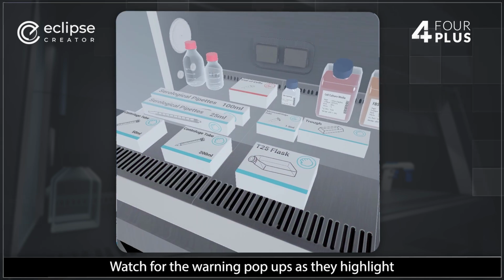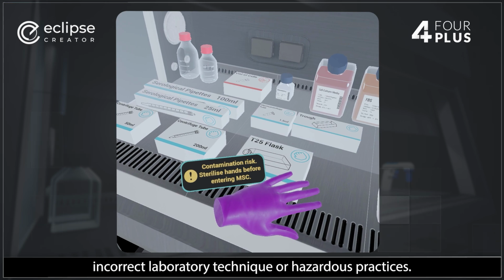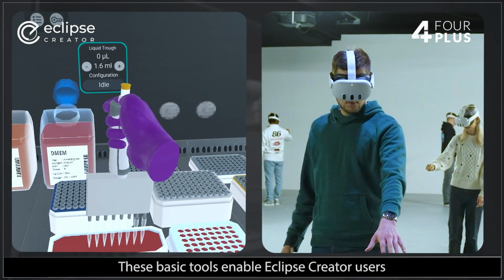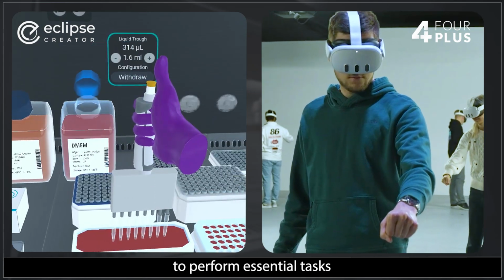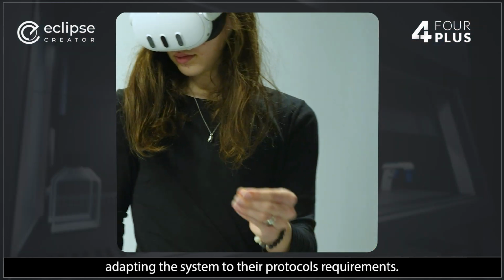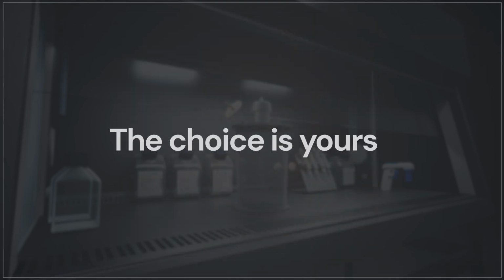Watch for the warning pop-ups, as they highlight incorrect laboratory technique or hazardous practices. These basic tools enable Eclipse Creator users to perform essential tasks and combine interactions, adapting the system to their protocol's requirements. The choice is yours with Eclipse Creator.